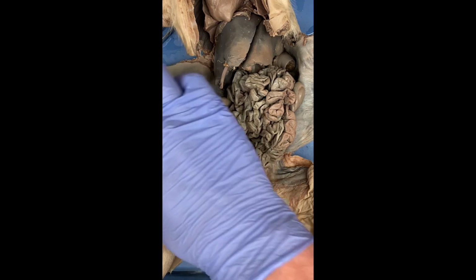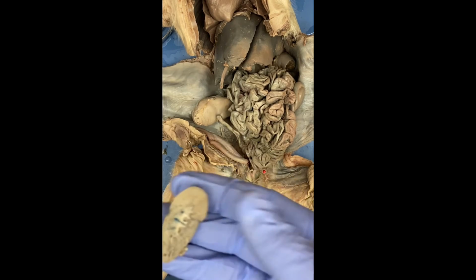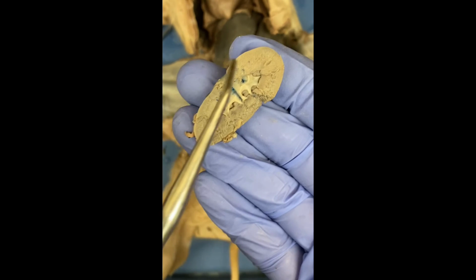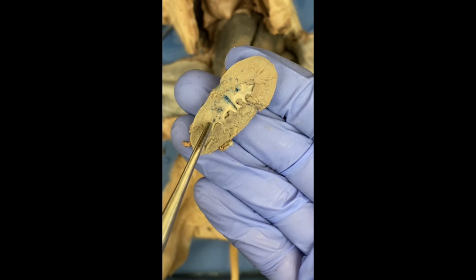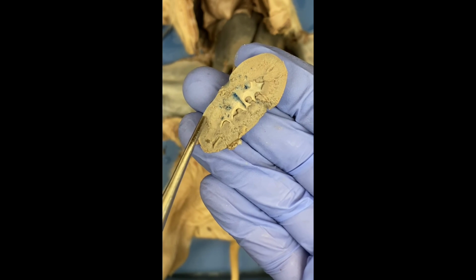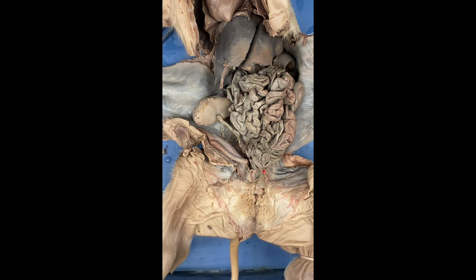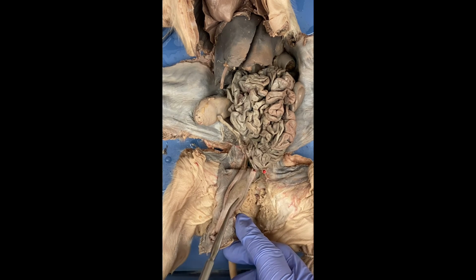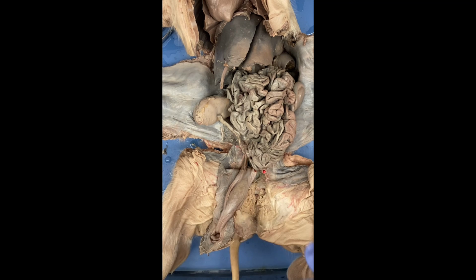Next, we're going to look a little closer at a kidney. Here's one that has been exposed. We have the medulla of the kidney, which kind of sounds like middle, and it's more like right here. So this is the medulla. And then we have the cortex of the kidney, which is the outside right here. This is the cortex. So those are the parts of the kidney. Then we have the urinary bladder, which is this right here. The job of the urinary bladder is that it stores urine until it is expelled by the body through the urethra.